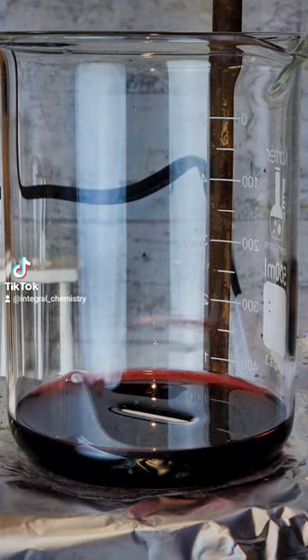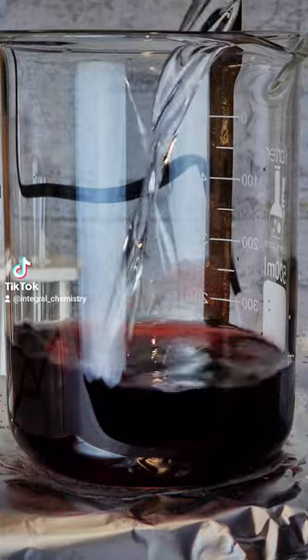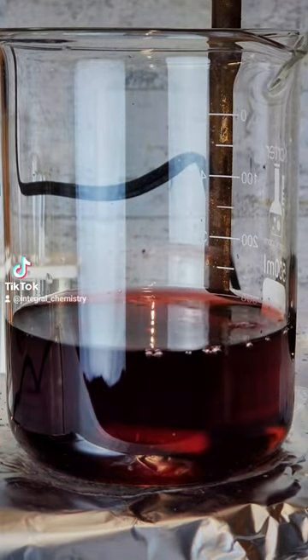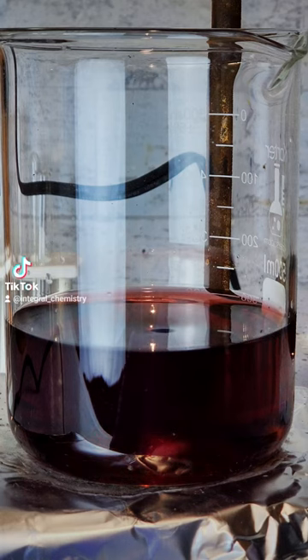Once all of the cobalt metal has dissolved to cobalt nitrate, I add some of it to a 500ml beaker, followed by a good bit of water to dilute it.